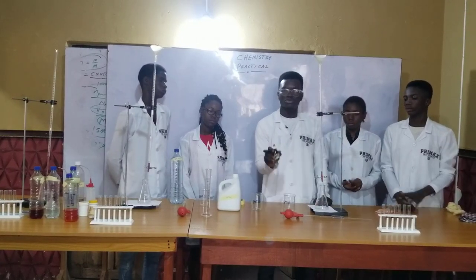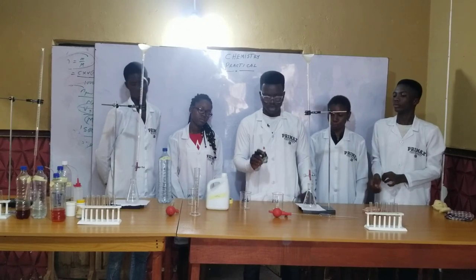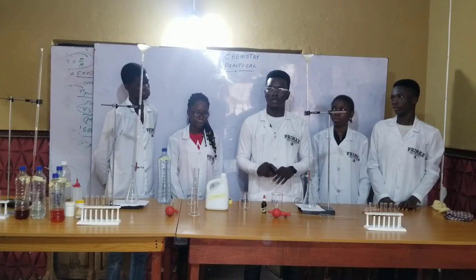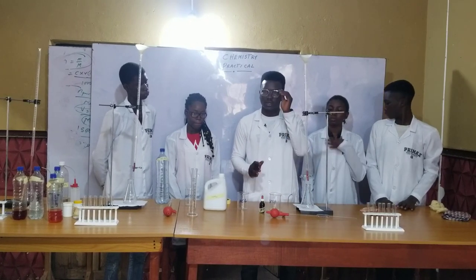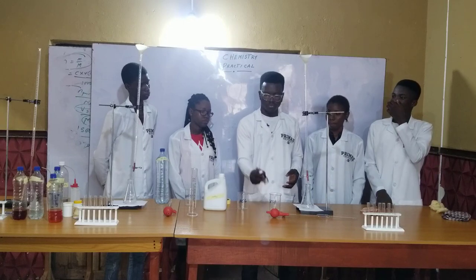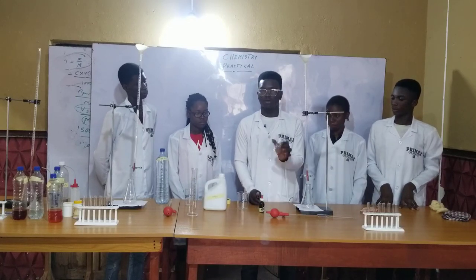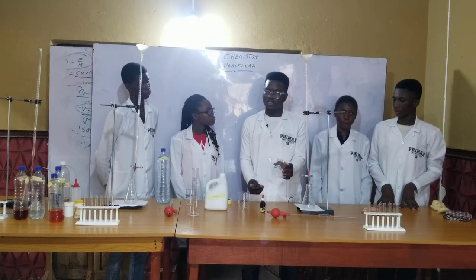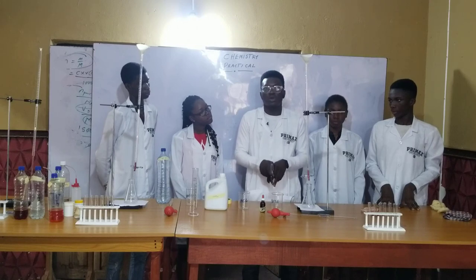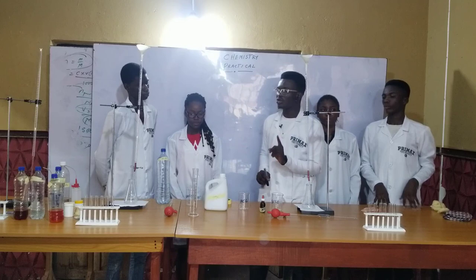We have been asked to use methyl orange. You are going to see a color change when the experiment starts. The color for methyl orange is actually orange, and when the color changes, you stop the experiment. At that point where you see the color change, we call it the end point, and you tabulate your reading.